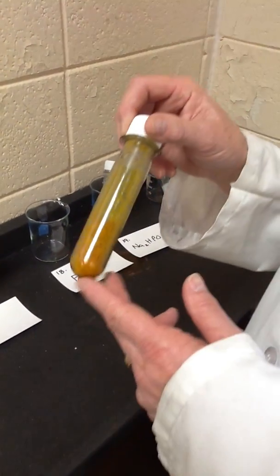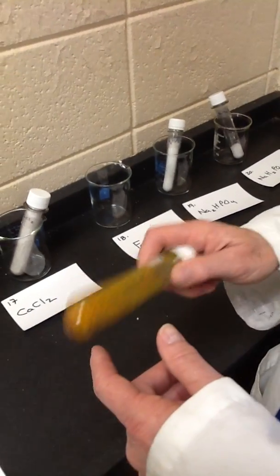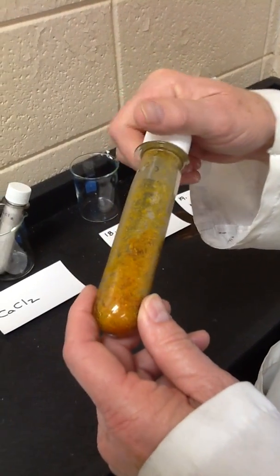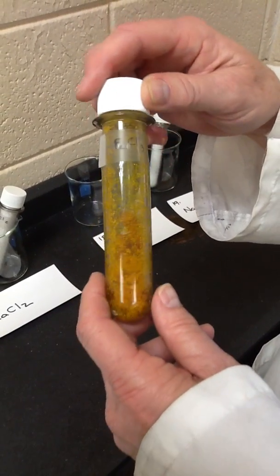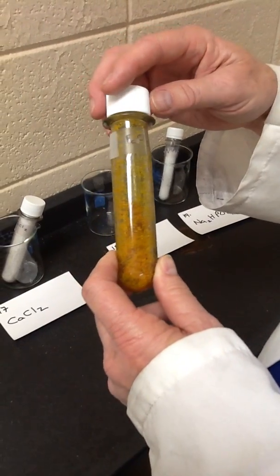I should go get the stock bottle. It's very interesting. It took me about 5 minutes to get this amount out. It's a golden, crystalline, but very wet crystal that sticks together. It's very hygroscopic, and it clumps and lumps up together. And in fact, if you look at the bottle, it gives its name.